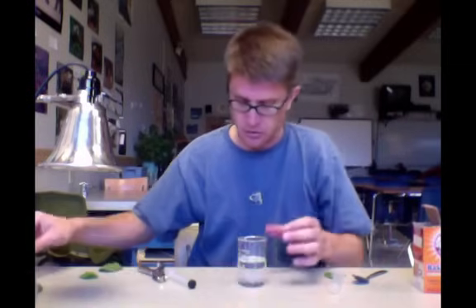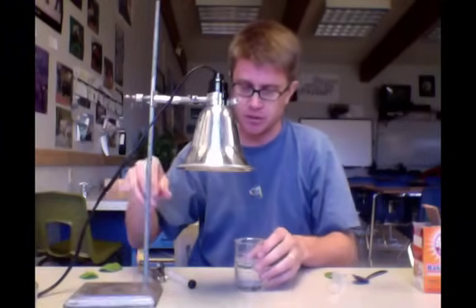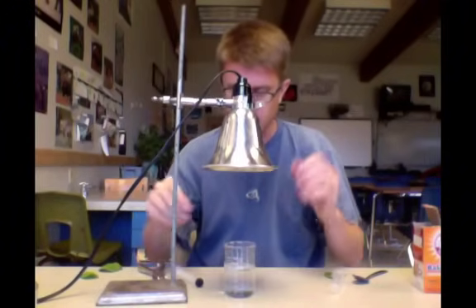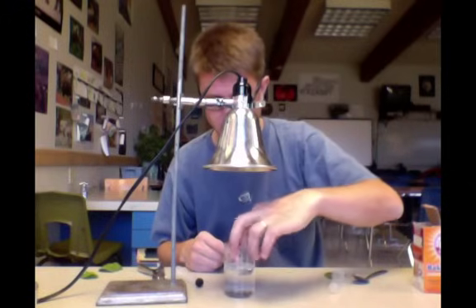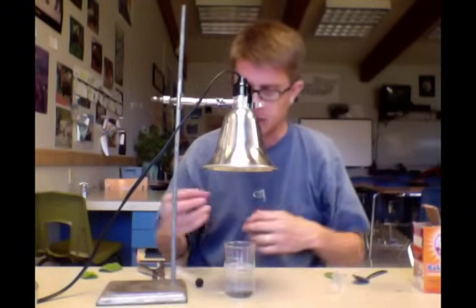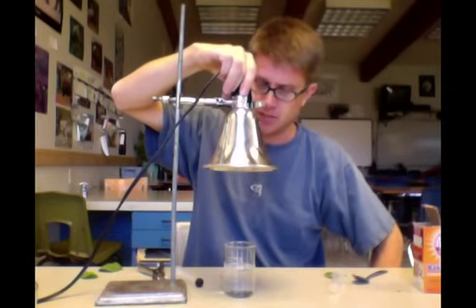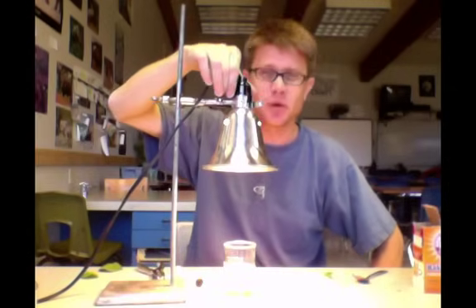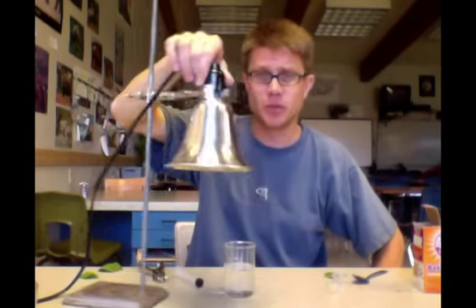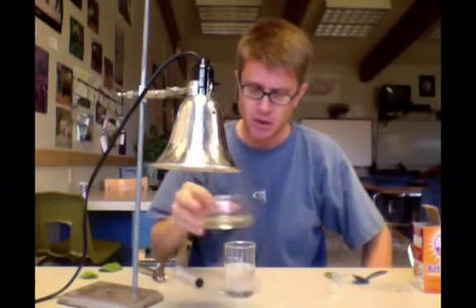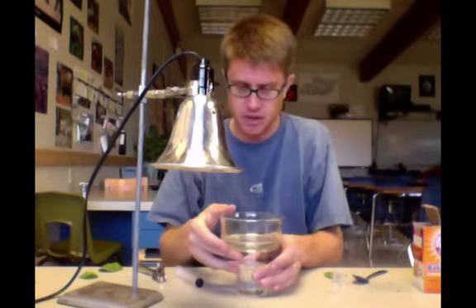The next thing I'll do is put light over the top of it. Now the one thing I should talk about, you can see there's one leaf chad that still is floating at the top, is that if I just shine a light like this it's going to get really hot in there. That will heat up the water and that's going to screw up my experiment, whatever my experiment might be. So you should also put this over the top.